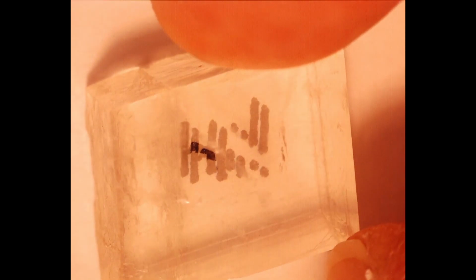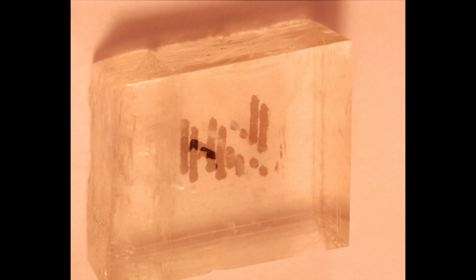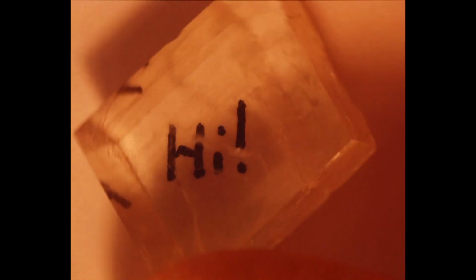We can learn something further about these two images though if we bring in a linear polarizer. When we bring in our linear polarizer, what I want you to notice is that one of these images is much more faded than the other. And as we begin to rotate our calcite crystal, what you'll see is that at certain orientations of our calcite, I can make one or the other ray completely disappear. So what this is showing us is that our ordinary ray and our extraordinary ray are actually both plane polarized, and they're plane polarized in mutually perpendicular directions.